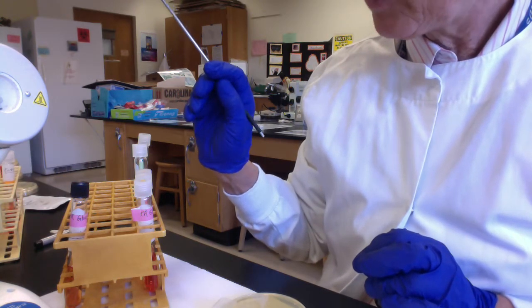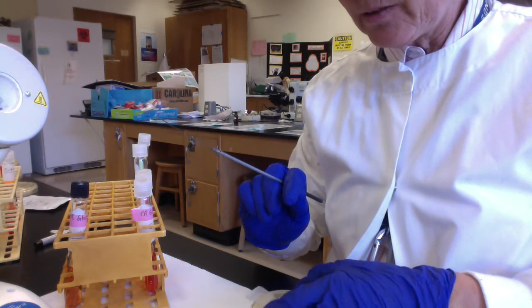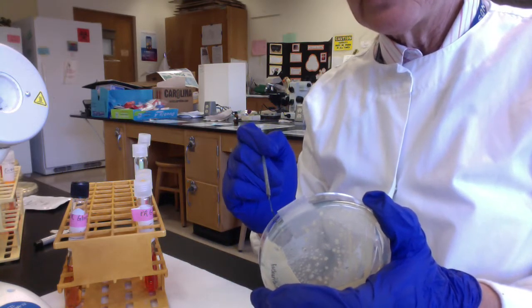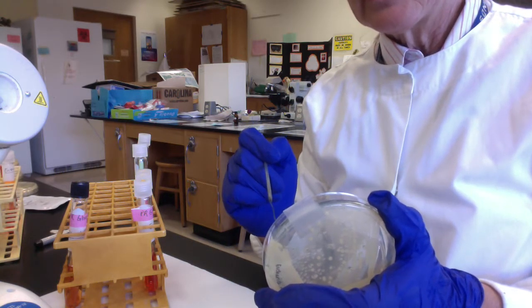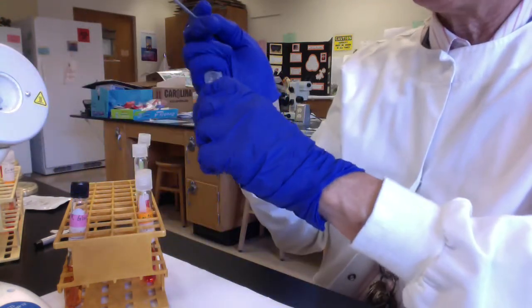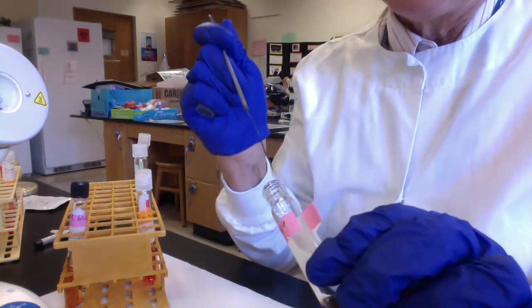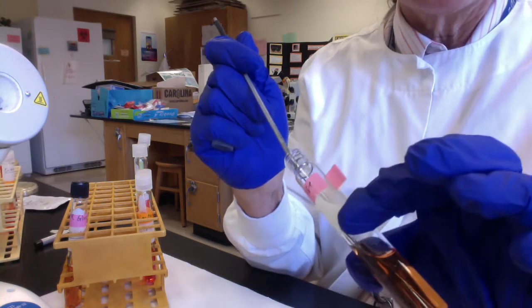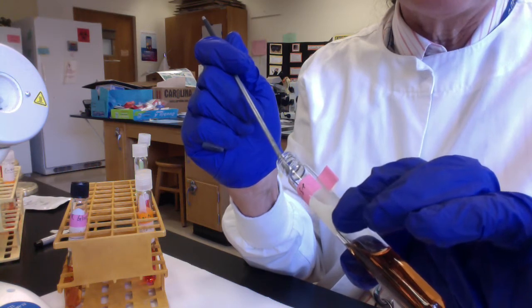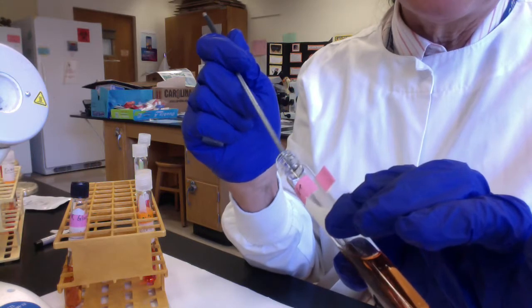Okay, so I've sterilized my loop. This is my pure culture of E. coli. I'm going to touch the agar to make sure that it is cool enough, and I gather some E. coli. This is going to get repetitive, you guys. We're just going to warm the cap, warm the lips, and then I'm going to insert my loop. Again, folks, all I really need to do is touch the loop to the liquid medium, and I should have lots of E. coli falling off, but I have a bad habit: I like to swish it around just a little bit.